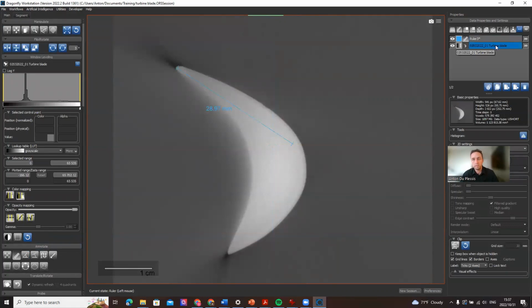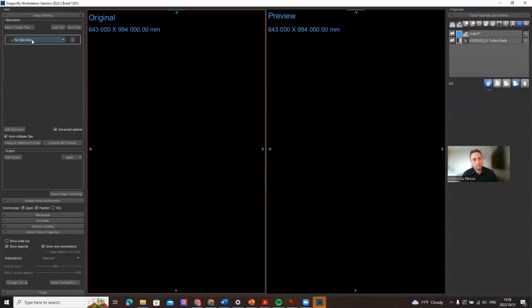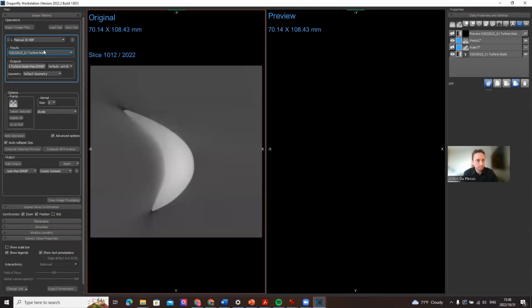To get to the manual 3D RBF filter, you have to click on the image channel or image object on the right, go to workflows, image filtering. In this filtering context, there are many filters here. You can also use denoising, like the median filter, for example. But what we're going to look at today is the manual 3D RBF filter.